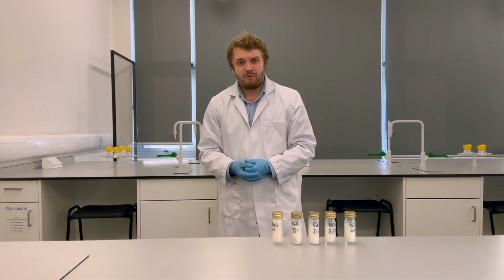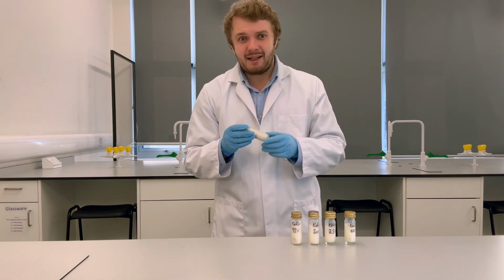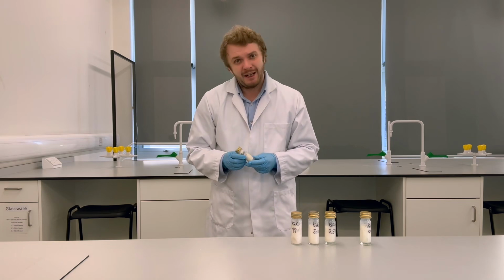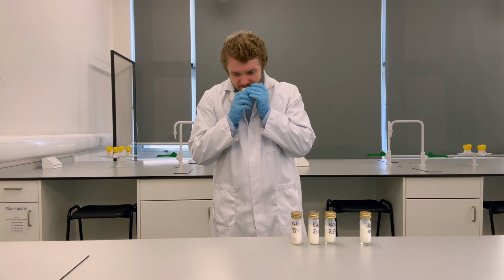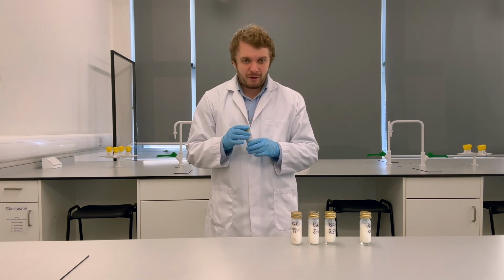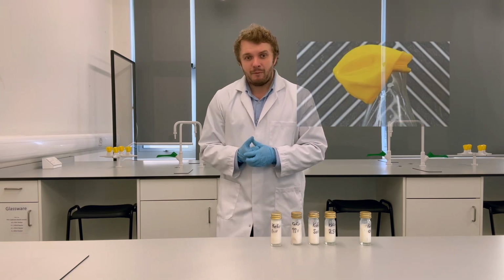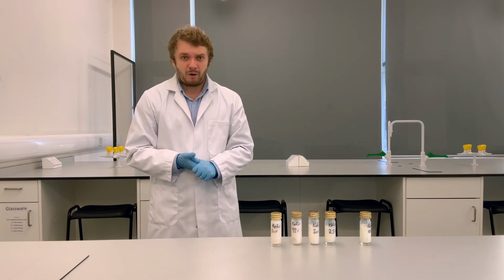So now that 48 hours have passed, we can examine our cultures and should find the 100% Kefir to be, as in this case, verging on a solid when compared to the milk control. This has primarily resulted from a combination of the secretion of polysaccharide sugars as well as the coagulation of the milk protein casein. I can also very much confirm that the production of lactic acid and other volatile aromatic compounds should be quite evident to your students too. In addition to these products, it is possible to demonstrate the release of carbon dioxide very easily by simply placing a suitable Kefir culture into an appropriate container and affixing a balloon to the top.